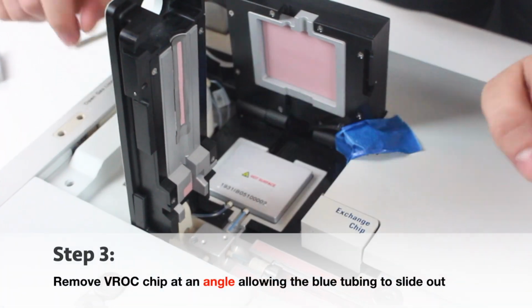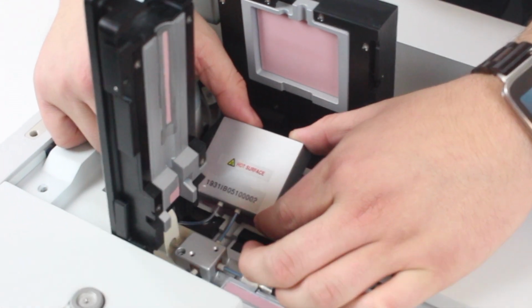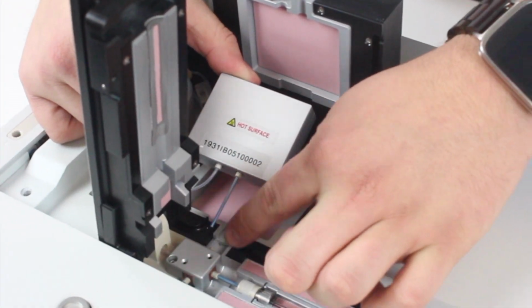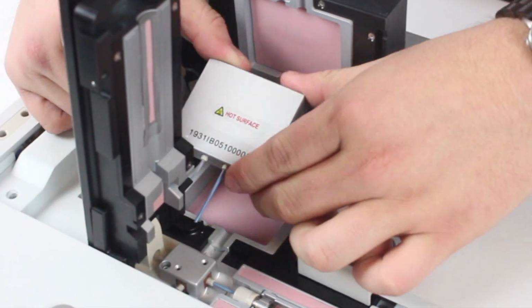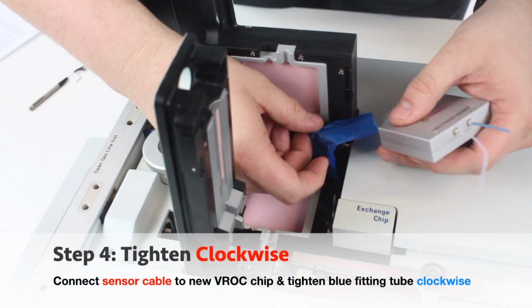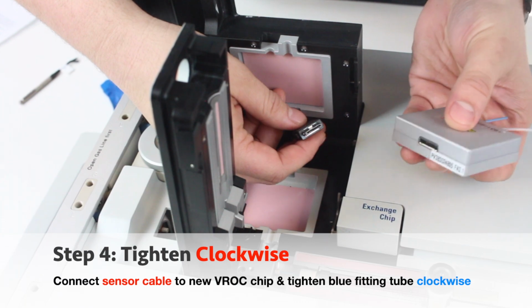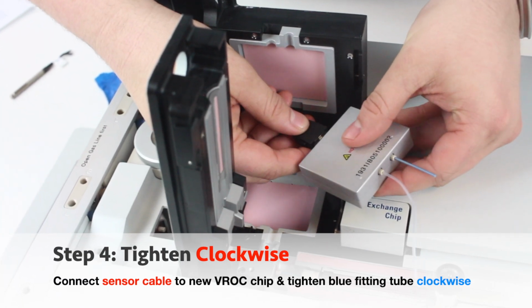Then, after all the fittings are taken out, you can grab the chip, lift it up at an angle, and pull out so that this blue peak tubing comes out and that the clear tubing comes off, and then you can take the old chip out. With your new chip, you can now take the cord, take the tape off, and you're going to plug the sensor cable into the back of the chip.